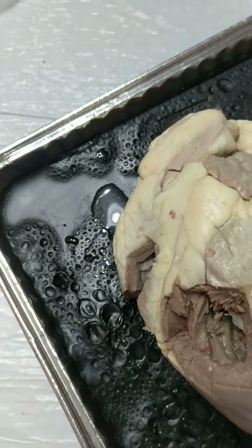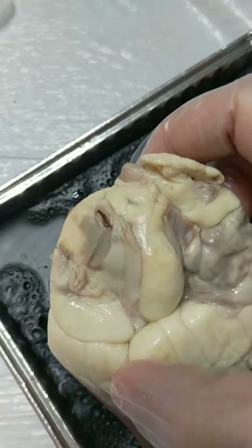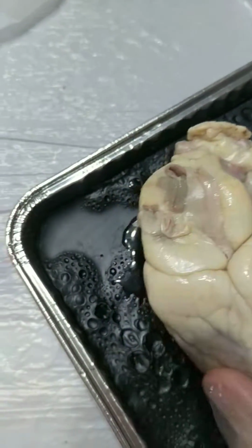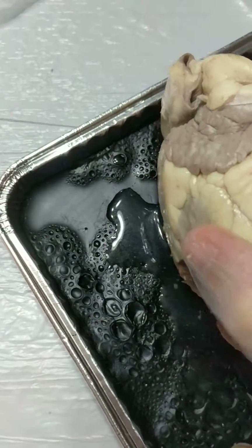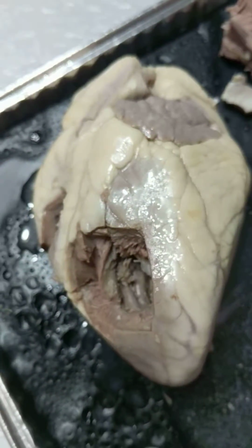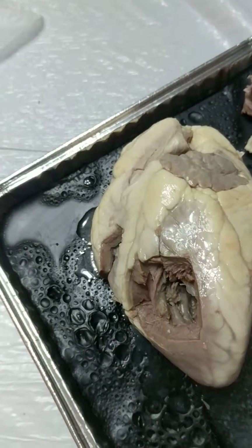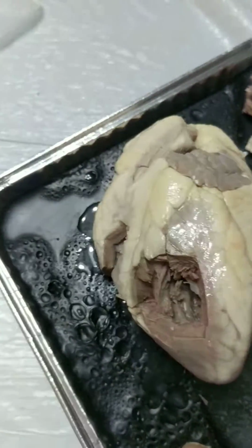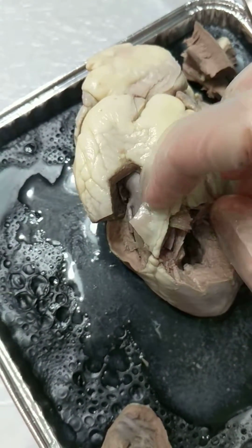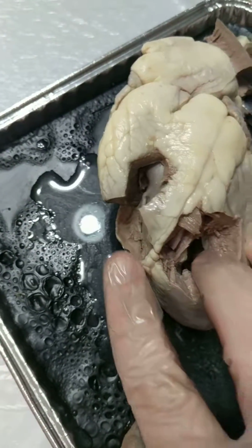The inferior vena cava, we can kind of see if we flip the heart over, is right up here in this region. And that's the vein that actually comes back and gives a lot of the blood from the lower portion of the body back to the heart. The interventricular septum is this large, unfortunately kind of butchered wall here. That's the muscle between the left and right ventricles.